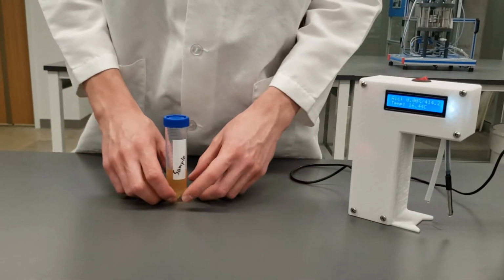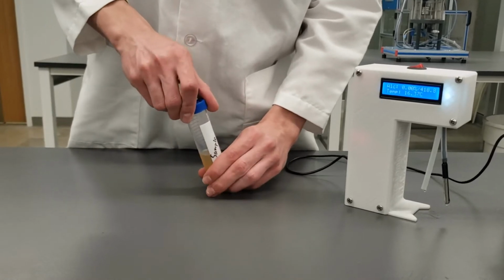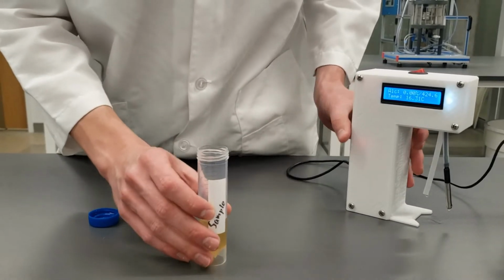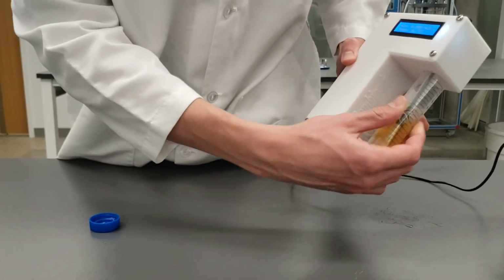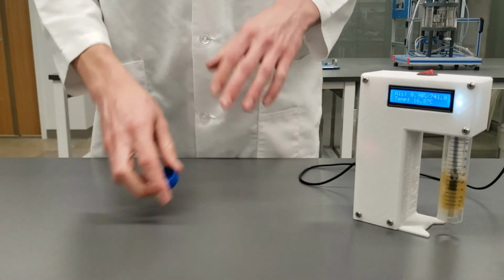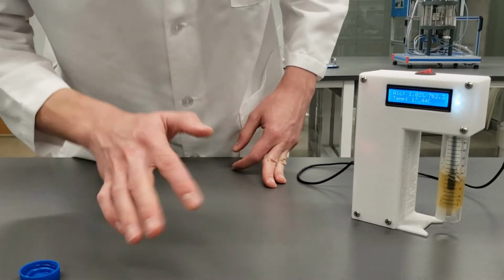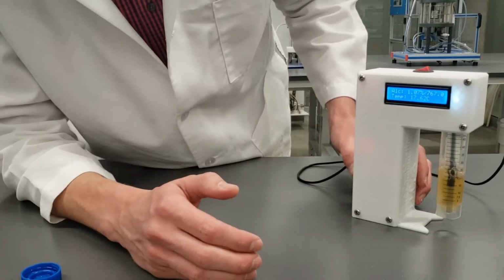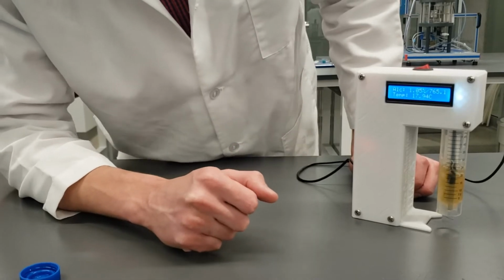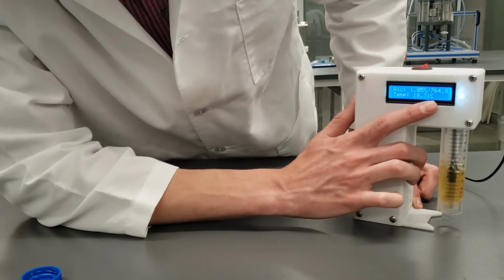Okay, so we've run all of our standards now, and I've typed them all into Excel. The last piece of data that we need to gather is for the kombucha that we want to test. So I would recommend measuring your standards and your samples and collecting all of the numbers and then putting it into the Excel document, just to prevent any bias. You might be like, oh, the kombucha is reading a little bit higher, maybe I had it too warm or something like that.